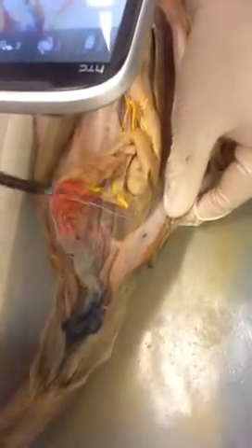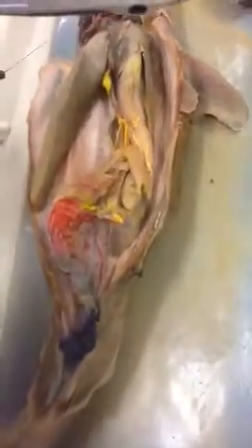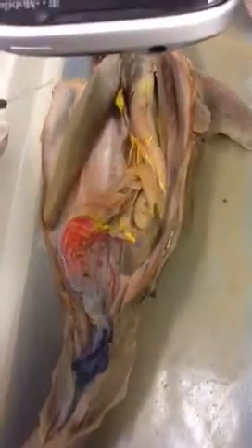If you pull this fold back, the pink is I think your epigastric. Double check that. Posterior epigastric artery, the pink, and that little pink one, and the blue are going to be your lateral abdominal veins. Just make sure I'm saying the right thing. Lateral abdominal veins.